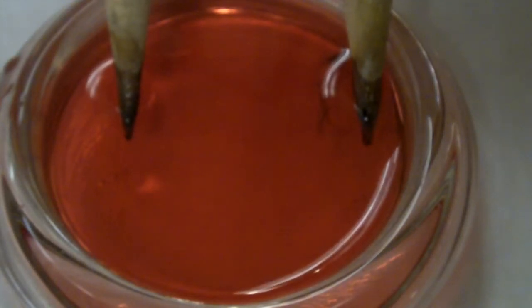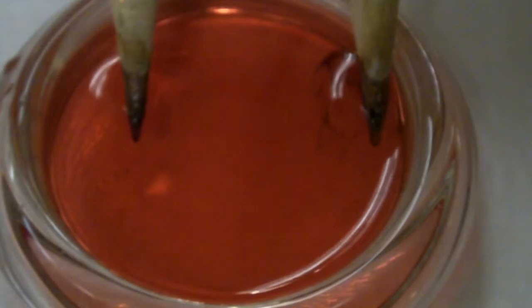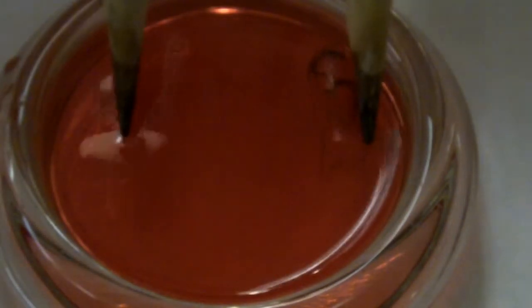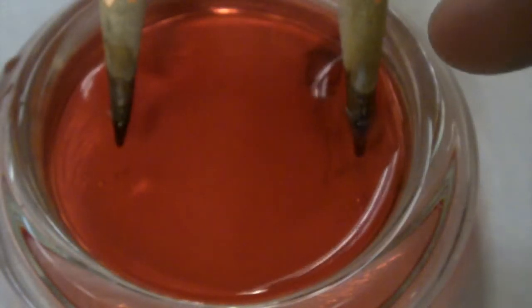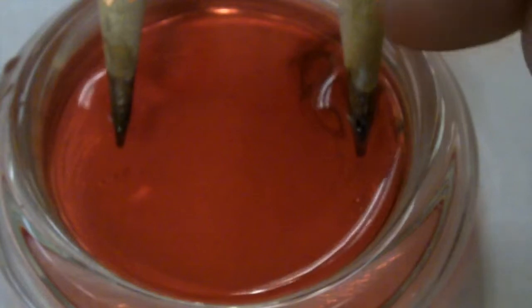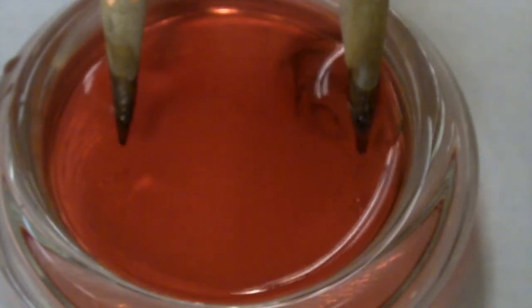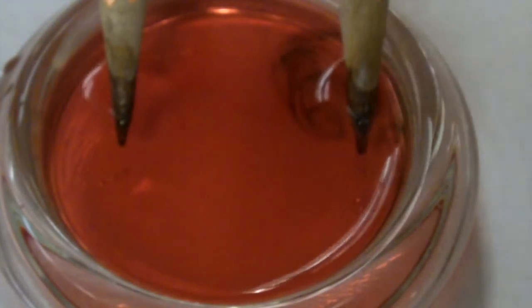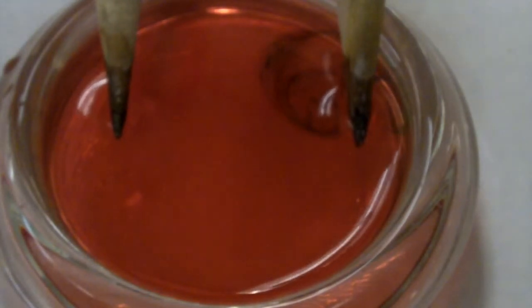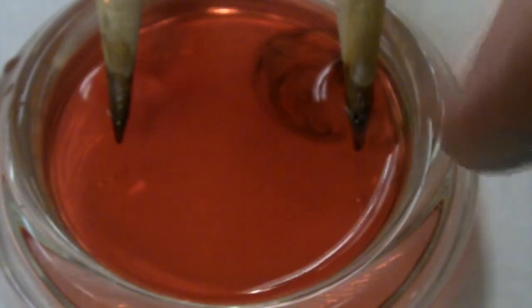I still see the bubbling over on the anode side and the bubbling on the cathode side, but over on the side of the cathode, it looks like we have some blue coloration around the pencil, and it's just kind of swirling around, as you can see. From my perspective here, it looks bluish, a little less so within the video picture.